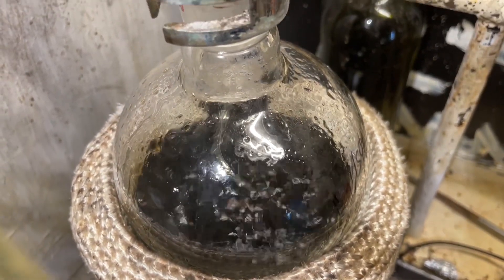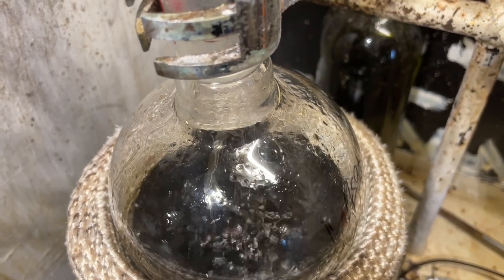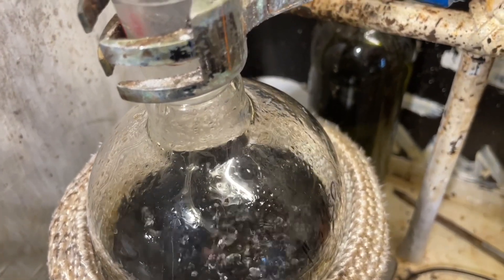During the reflux you are able to observe water refluxing in the flask — that is from the acrolein synthesis. The reason why this makes so much tar is because it uses glycerin to form the acrolein in situ, which is quite a messy reaction.